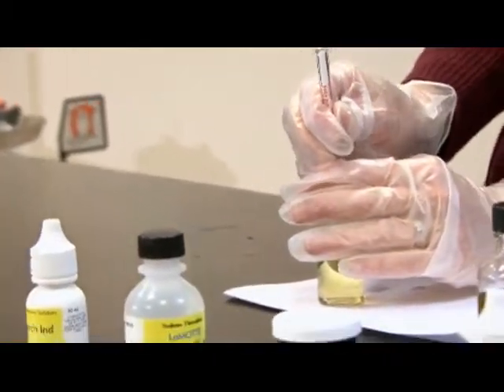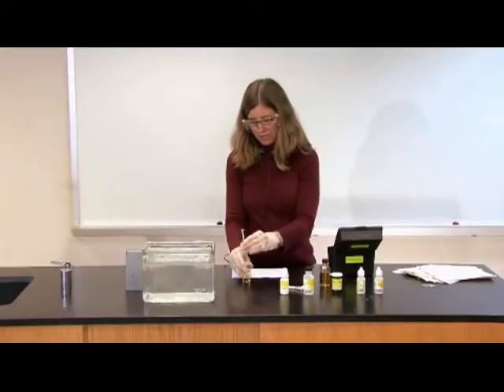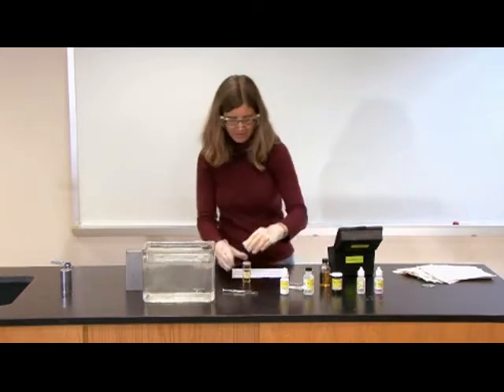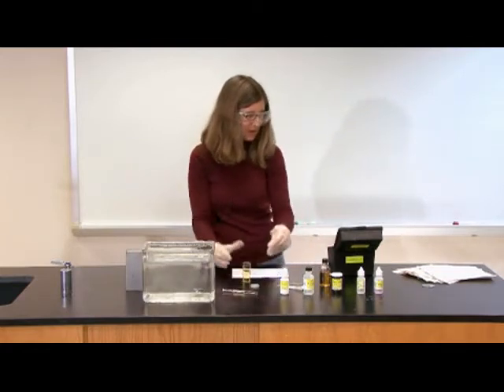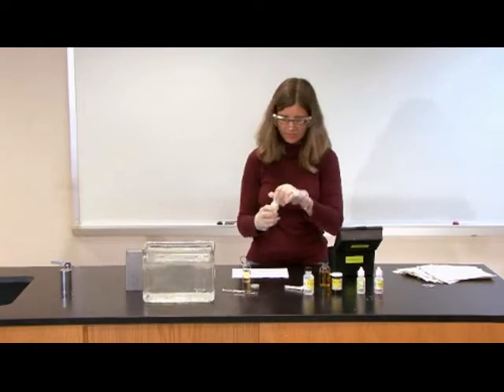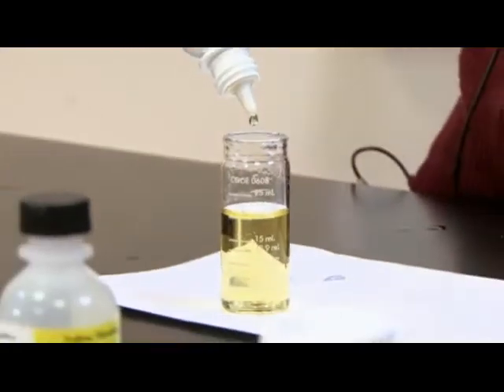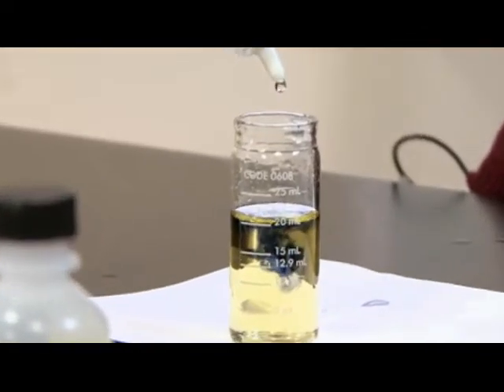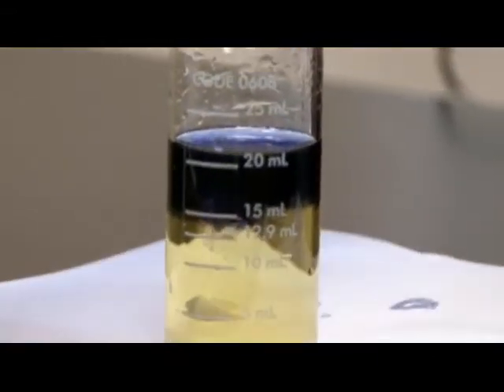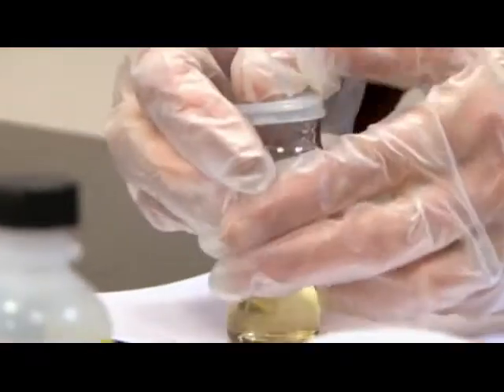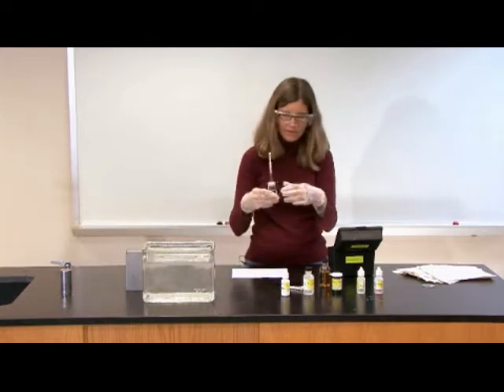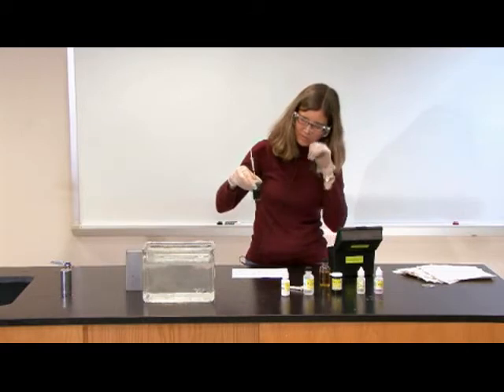One thing that's very important is I'm now going to remove my titrator. But I don't want to change the position of the plunger on the titrator. I need to leave this exactly as it is. I'm going to just set the titrator down. Take the lid off my titration tube. And now I'm going to add eight drops of my starch indicator. So now I put the cap back on. And I put the titrator back in. And of course I haven't adjusted the position of the plunger on the titrator. And I can swirl my sample. So you notice it's a blue color now.